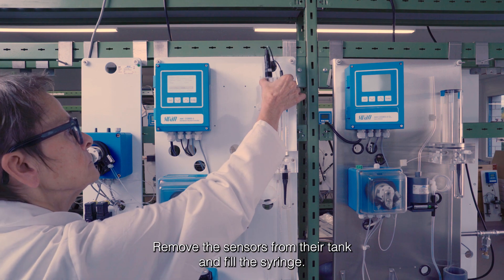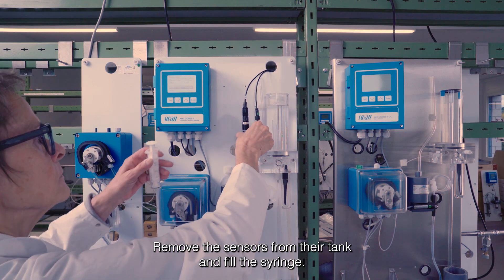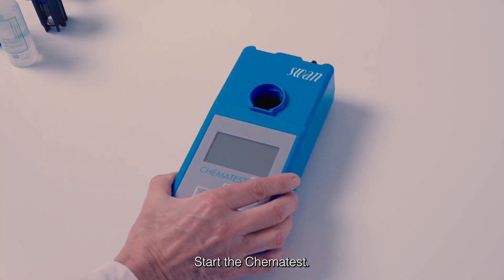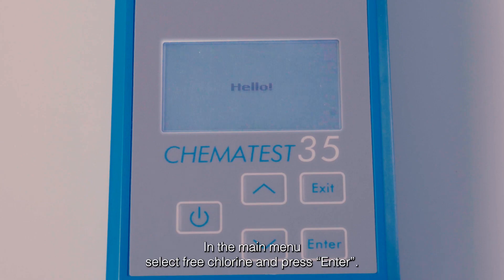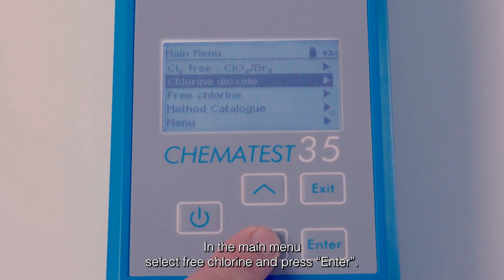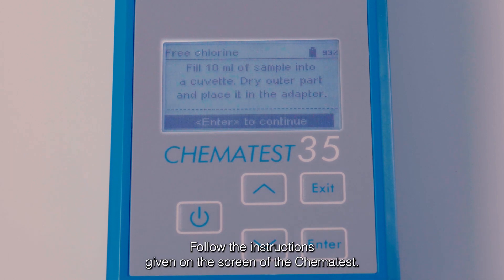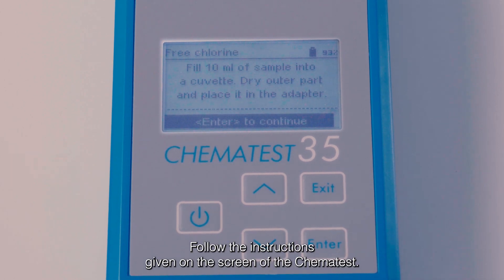Remove the sensors from their tank and fill the syringe. Start a chematest. In the main menu, select Free Chlorine and press Enter. Follow the instructions given on the screen of the chematest.